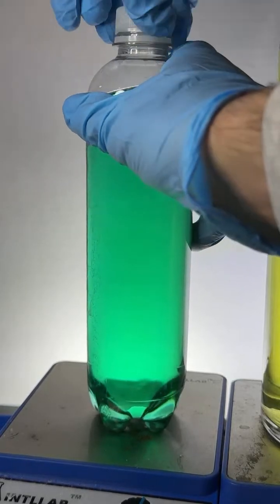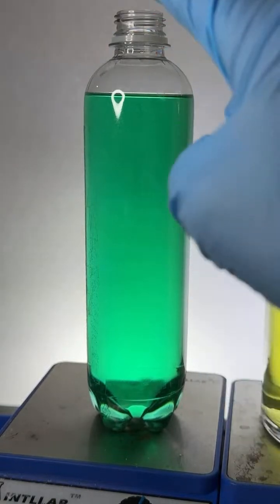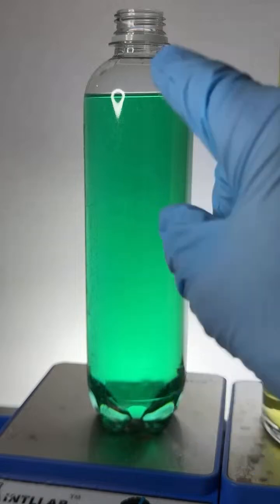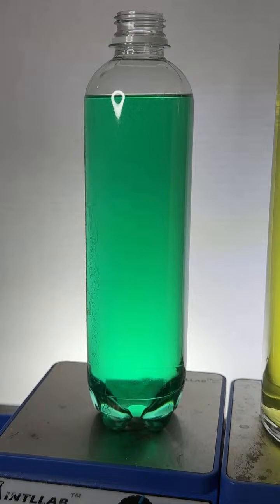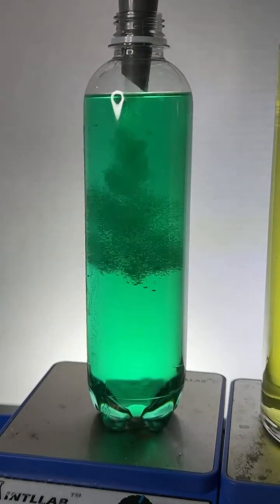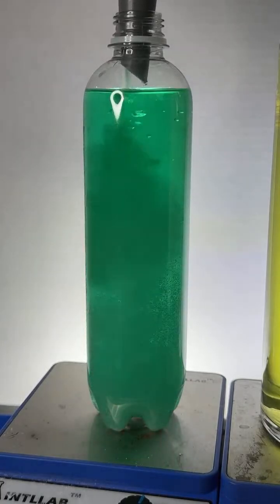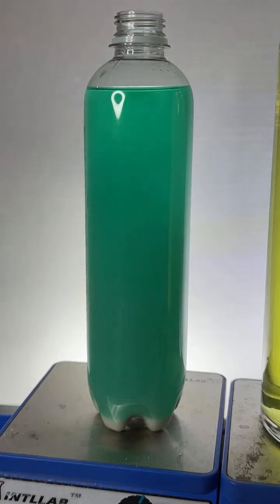All right, here we go. So just to remember what's going on here, we've got water in here, we've got isopropyl alcohol in here, and we've got blue dye and yellow dye. Okay, here we go. Up at the top, you can see the funnel I've got. I'm going to add this white solid, which is sodium carbonate, and it goes. So again, I'm adding a white solid, a particular salt, to a mixture of water, alcohol, blue dye, and yellow dye.